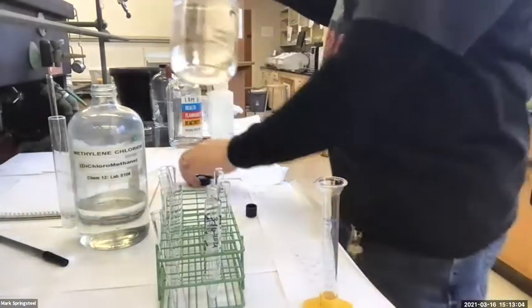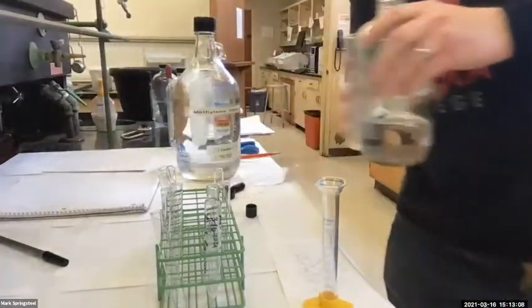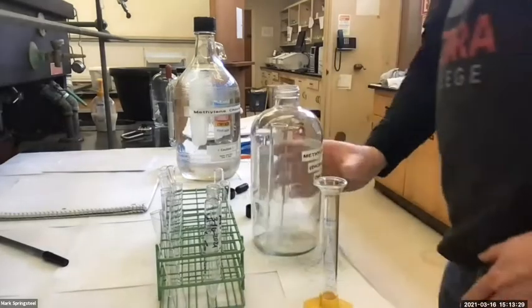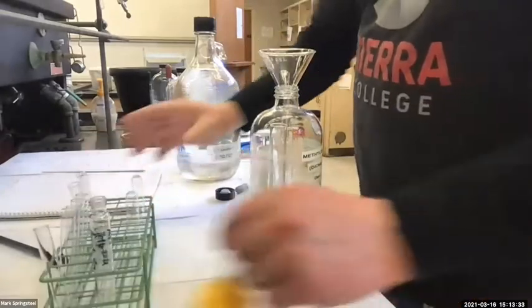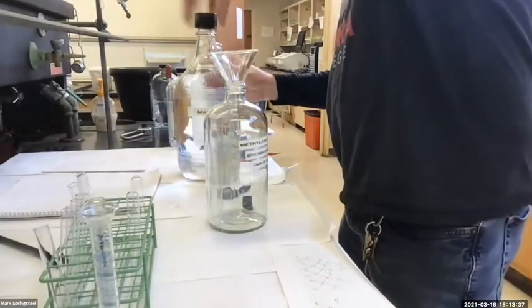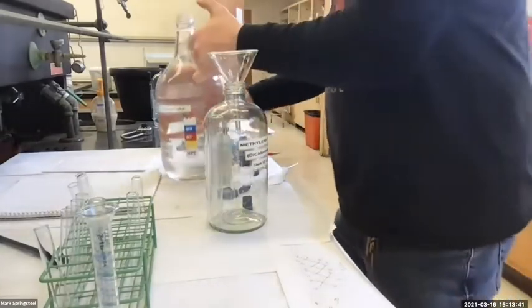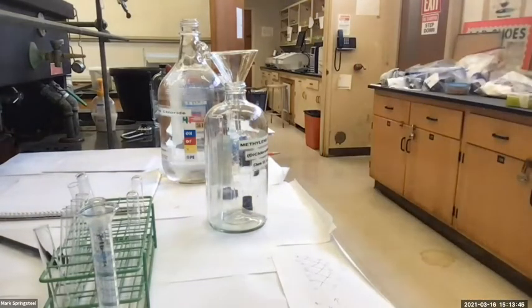Actually, I'm gonna just prepare some fresh methylene chloride for us. Just a second. I'm gonna put this in a waste container. And so this right now, what we're doing right here, is called research. Completely common. Something always goes wrong and you just gotta be a good sport about it. Find your way around it. So I poured out that contaminated methylene chloride and I'm gonna pour in some more. And before I do it, I'm gonna do something else too.